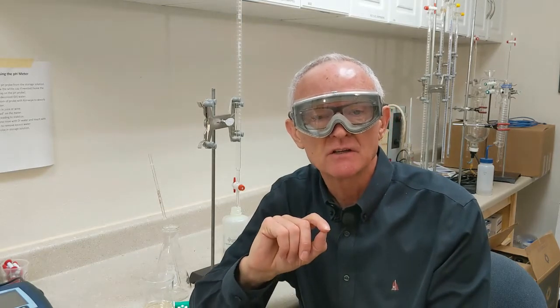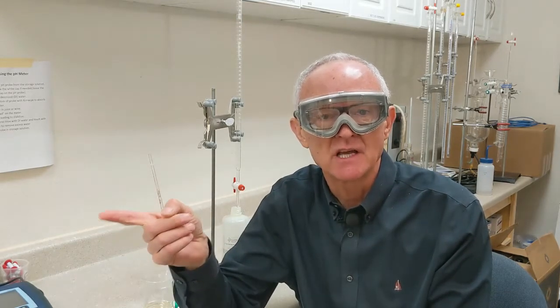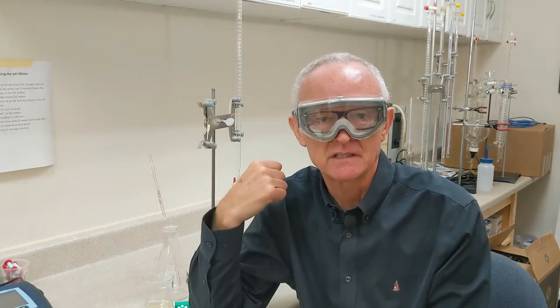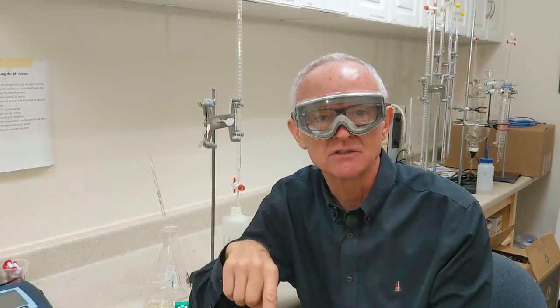And wear your safety goggles if your lab mate is doing an assay because they may splash and it may impact you. Even if you're not working on an assay at the time, wear your safety goggles to protect yourself from anything else going on in the lab.